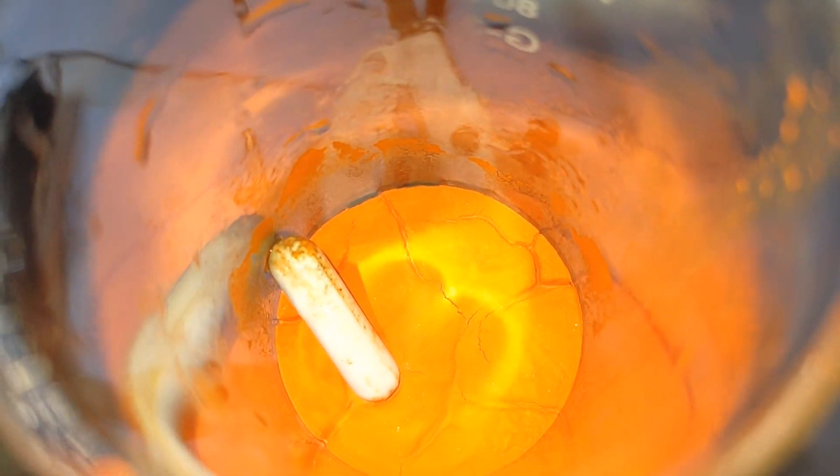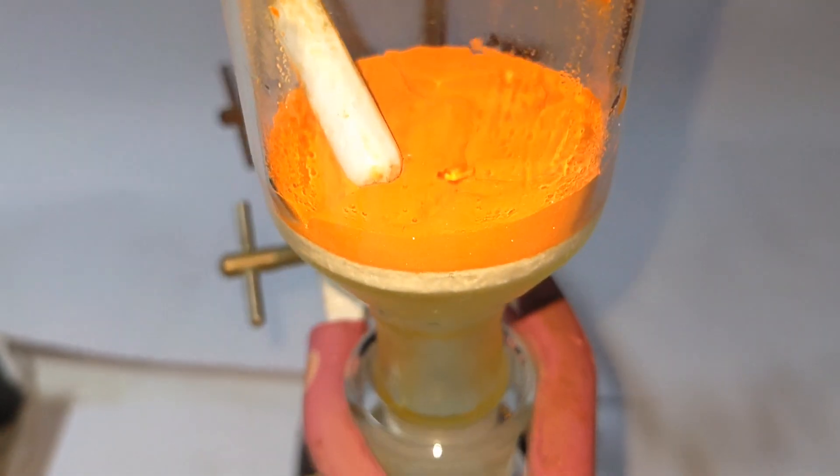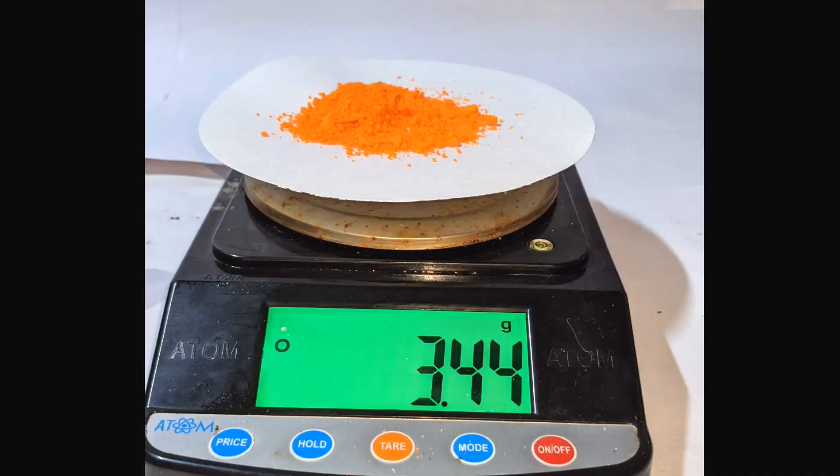Here is the product that is dried in the filter flask and it was taken out and weighed to 3.44 grams.